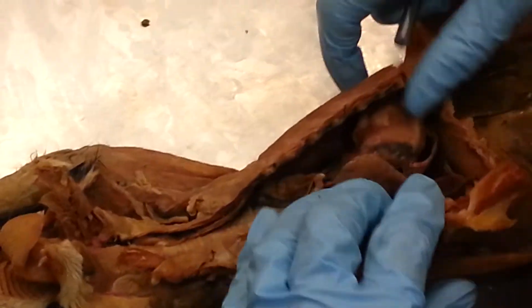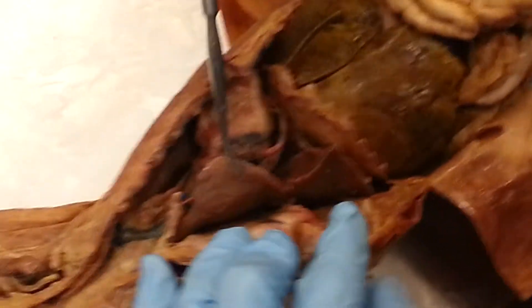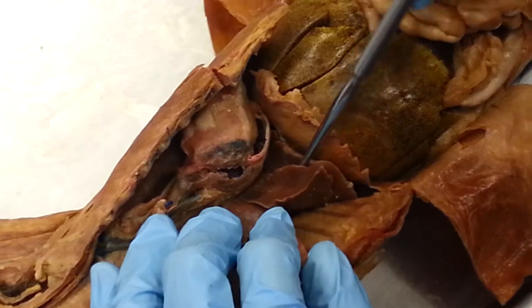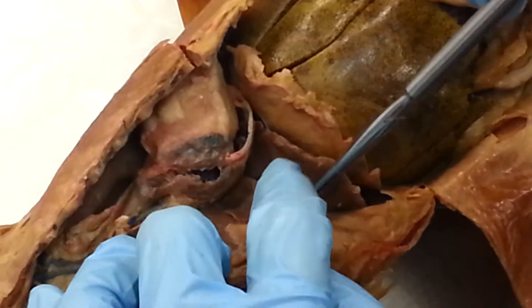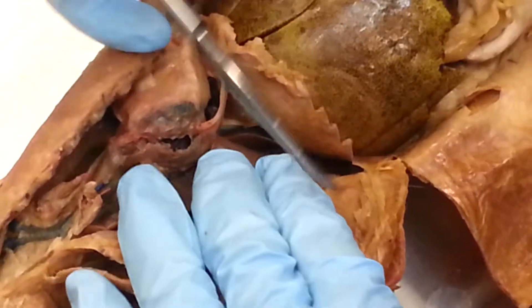This is the anterior lobe of the lungs. Then this is the middle lobe right here. And then this is the posterior lobe. And then the accessory lobe is down in there.